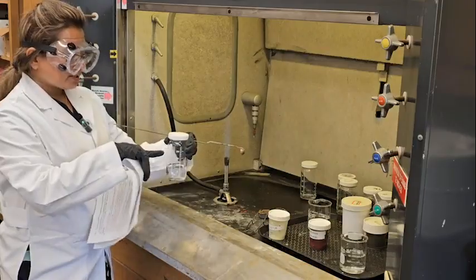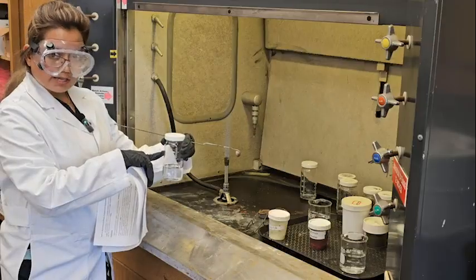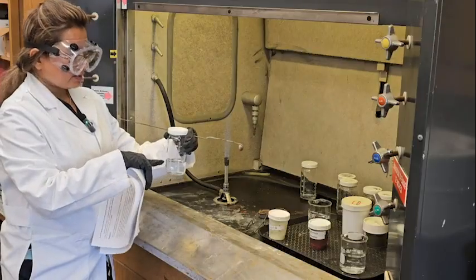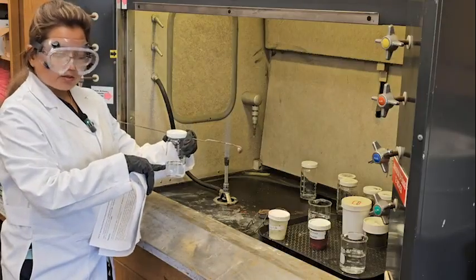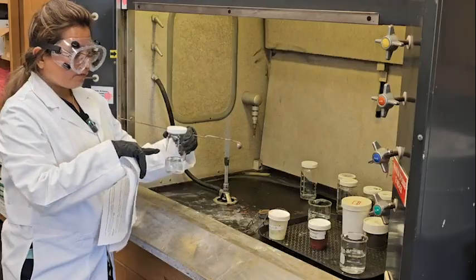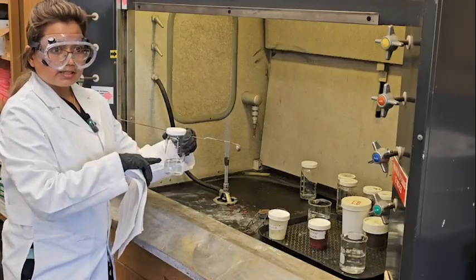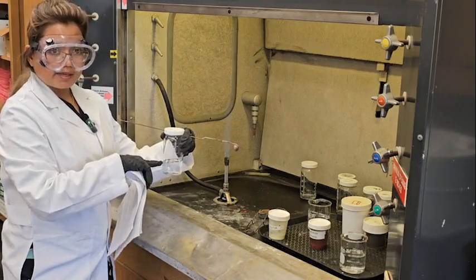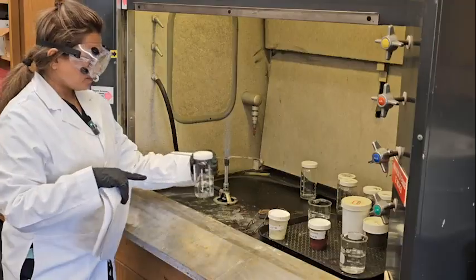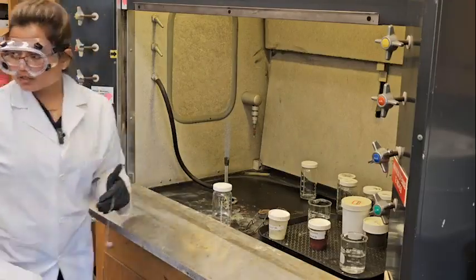The element reacts with the oxygen and we get the oxide. That oxide reacts with the water, and that water we will collect for part 4 to check the pH, whether it is acidic, base, or neutral. Okay, so that's our objective for the lab.